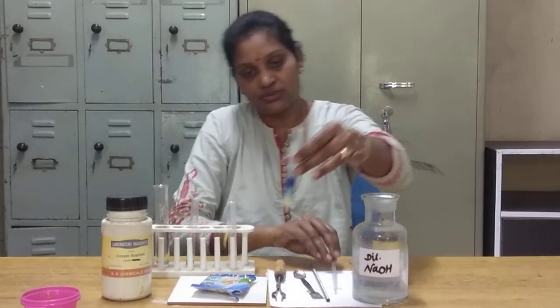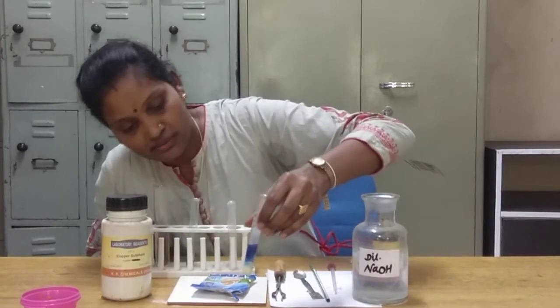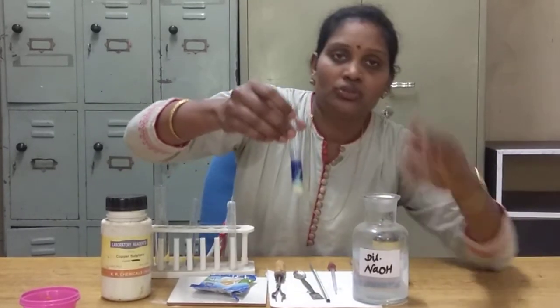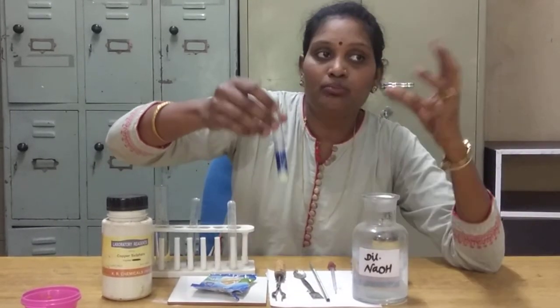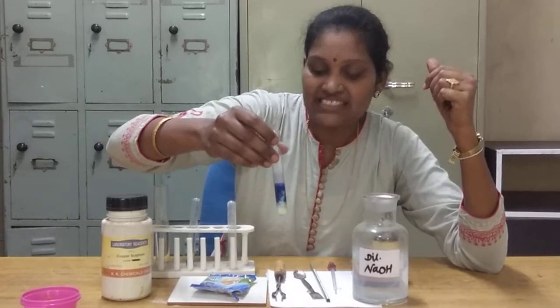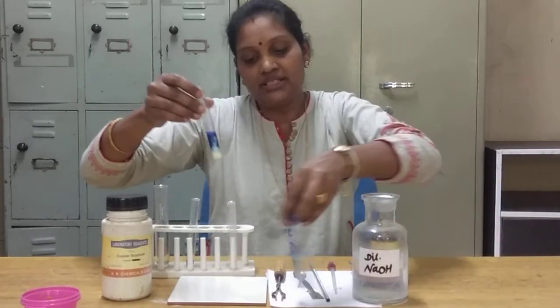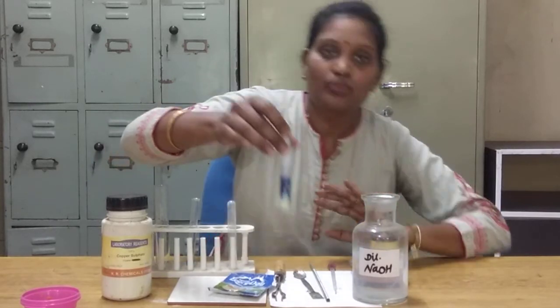You can see, dear students, the change in colour — that is violet colour. The darker the colour, the more is the presence of proteins. This shows that this milk powder contains protein.